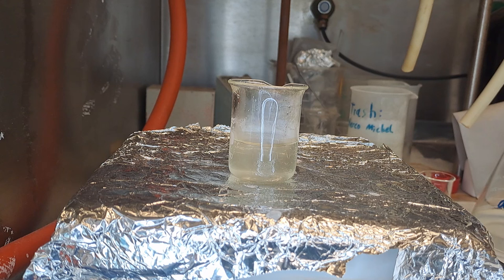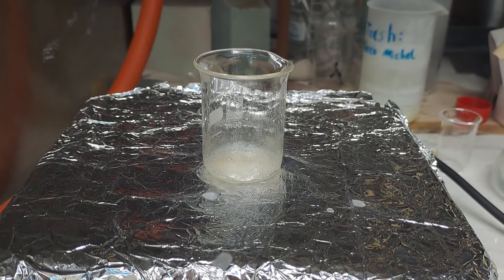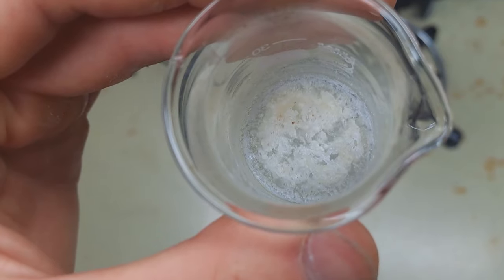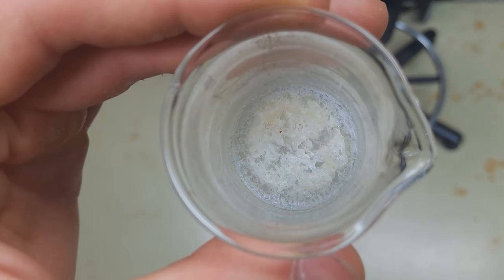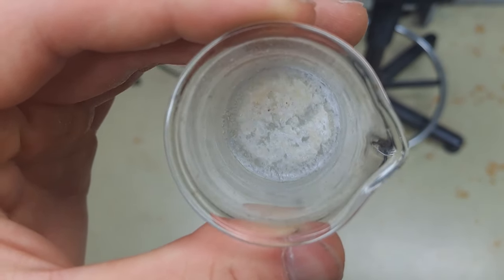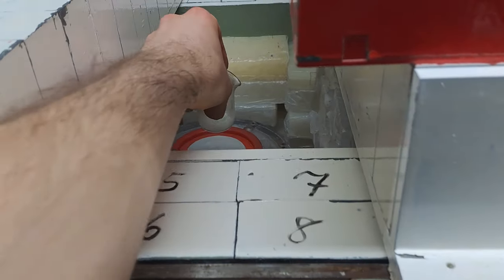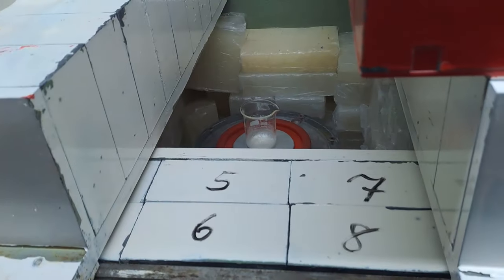After allowing it to evaporate for several hours, you will have crystals with a high potassium carbonate content, which in turn naturally contains a significant amount of potassium-40. Before encountering any further losses, the entire beaker will be placed in the gamma detector.